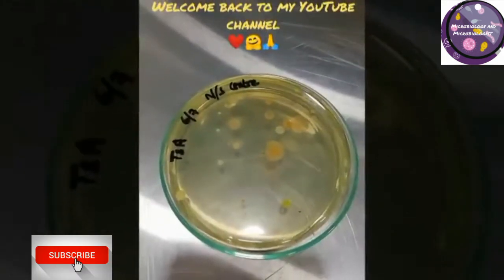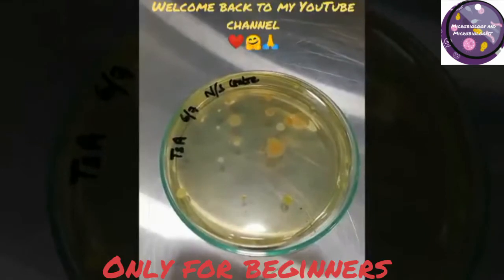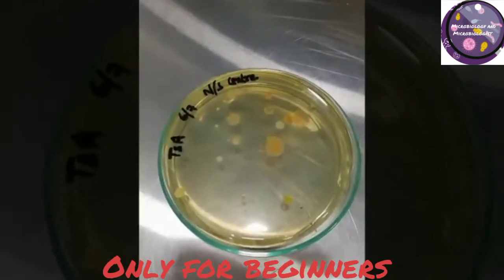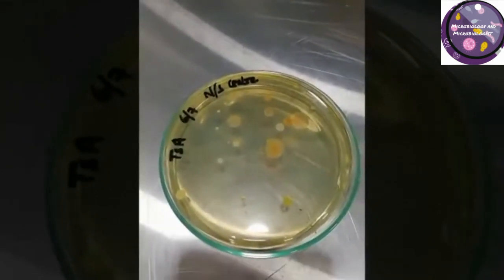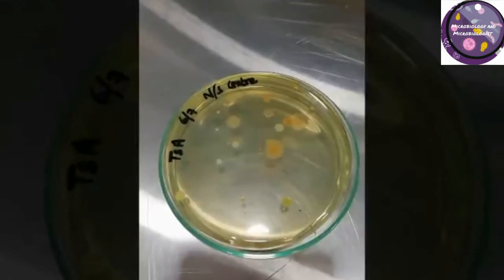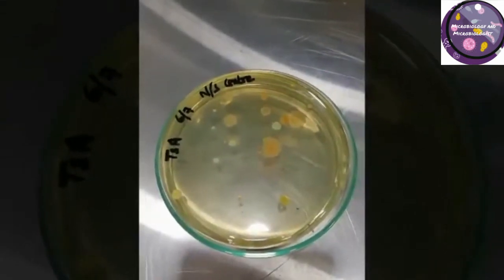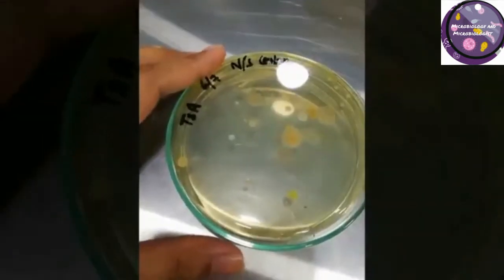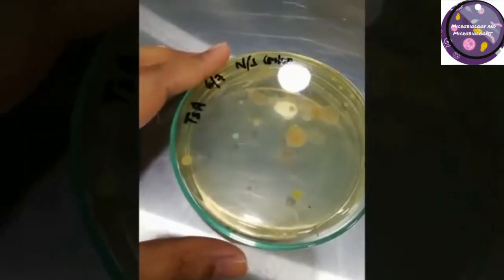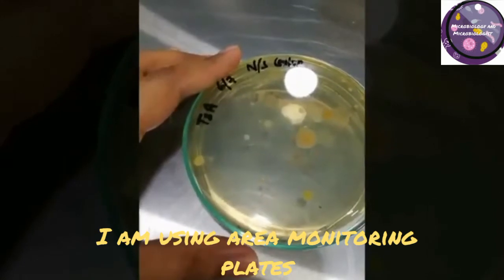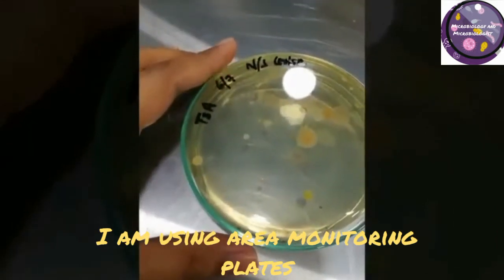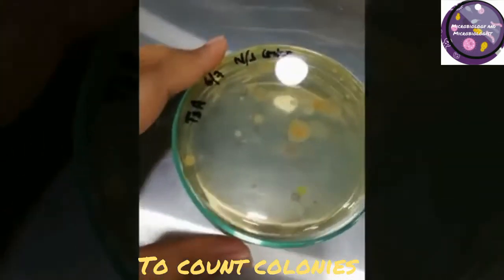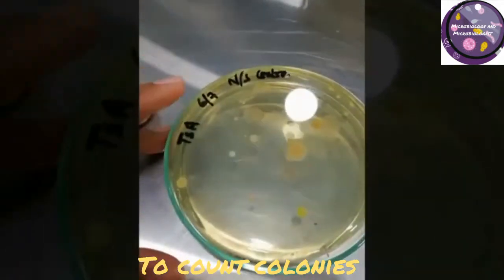Today I'm going to show you how to count colonies manually and by colony counter. Let's get started. This plate is my area monitoring plate that I exposed three days before, and after three days of incubation I found these colonies.